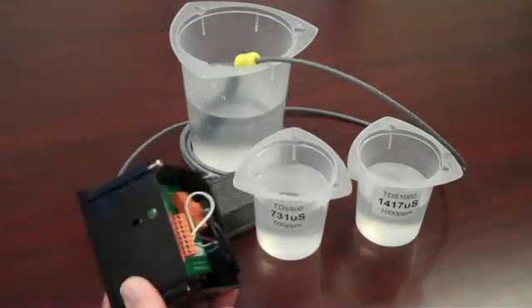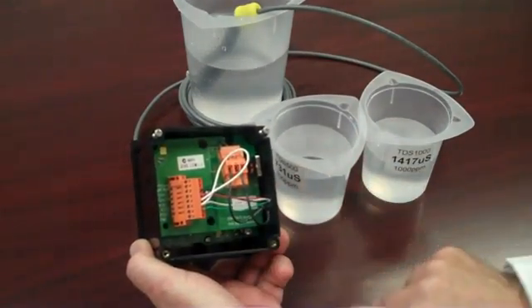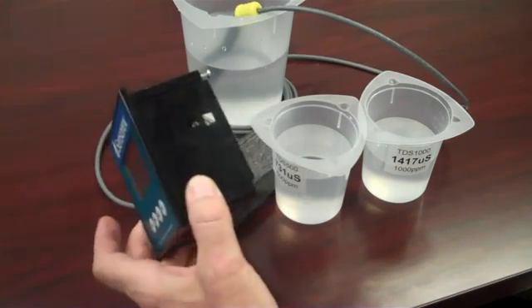To calibrate, connect your conductivity sensor to the instrument. If you have temperature sensor leads, connect these to the instrument as well. Follow the user instructions for connecting the wire leads and calibration of the sensor in the owner's manual of your instrument.